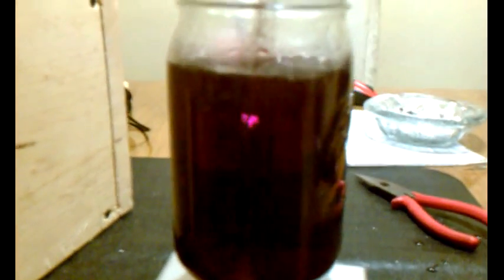Okay, I'm getting near the end here. You can see a very dark color. It's gotten to where you really can't see the electrodes inside, although you can still see the fire. So the color is a real dark red color. I don't see any purple in this one at all. I'm very happy with that because all the batches I had before had purple in them. Alright, you're going to have to turn them down.